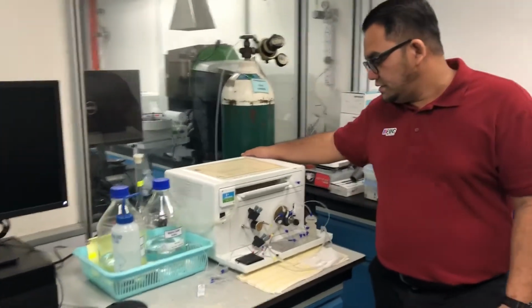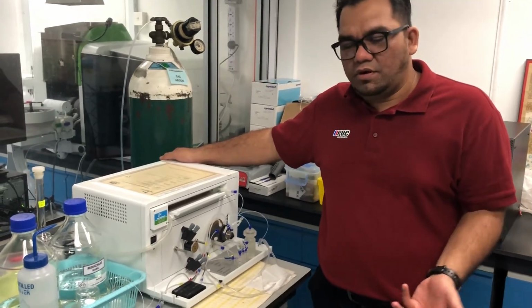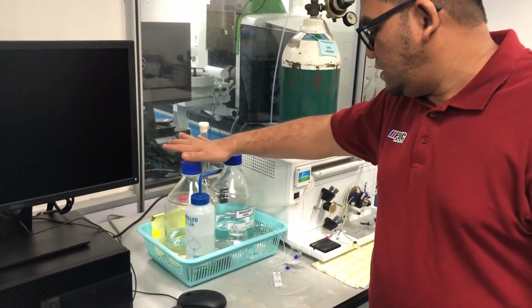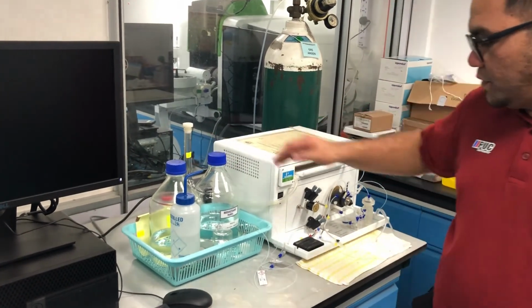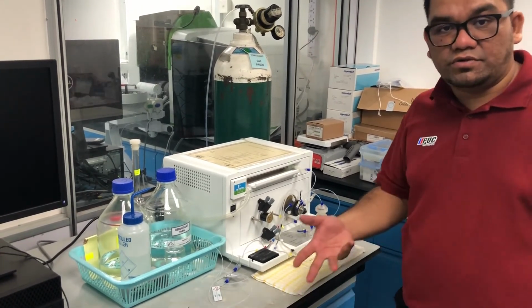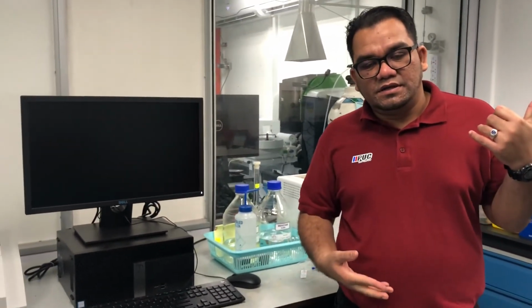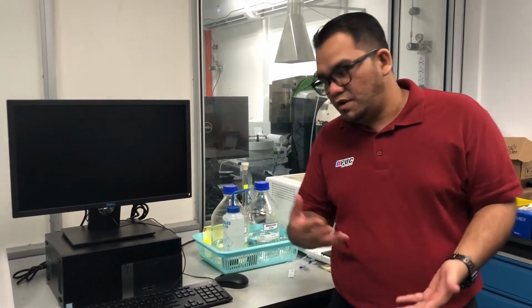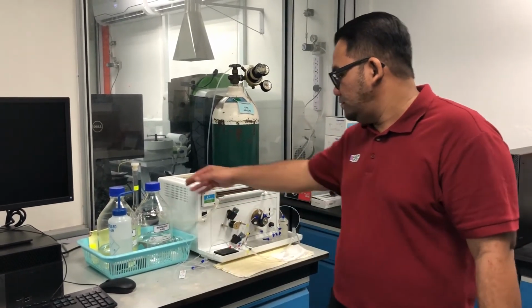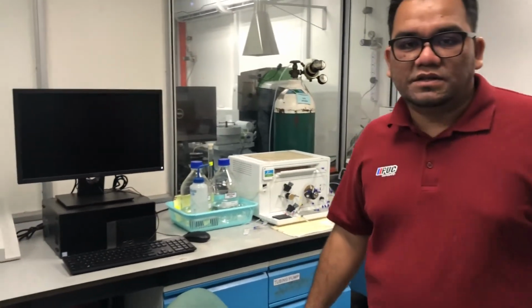Hydride generation AAS. We don't need any complex atomizer using a heating system like flame or electrothermal system. We only need what we call a cold vapor system, right? We just react hydrochloric acid and sodium borohydride to produce a vapor of the sample containing our mercury analyte, and you can just detect the absorption. Similar to flame AAS or graphite furnace AAS, right? But this one has no heating process because mercury is easily vaporized, so we use a cold vapor system. It's quite simple compared with the other instruments, right?